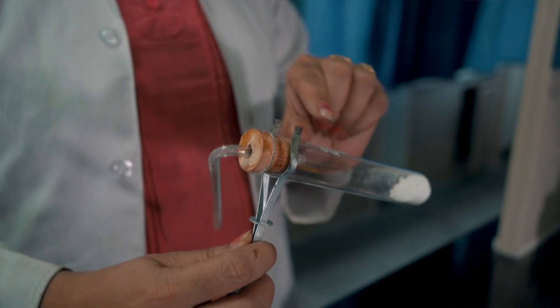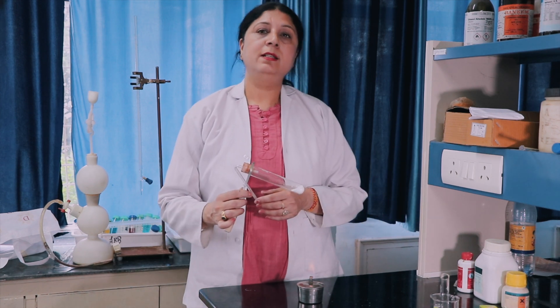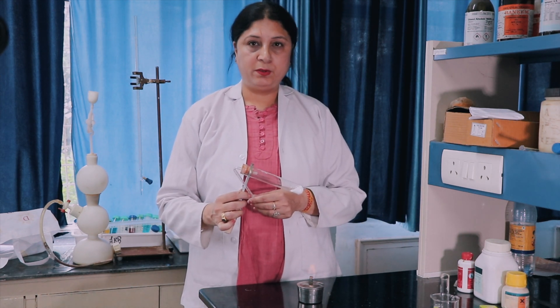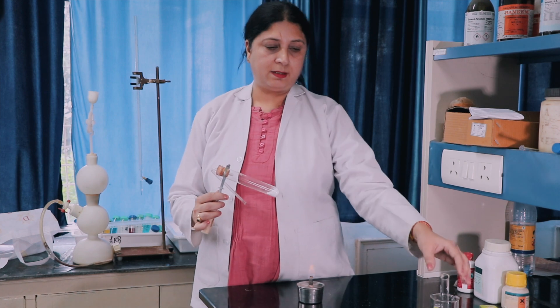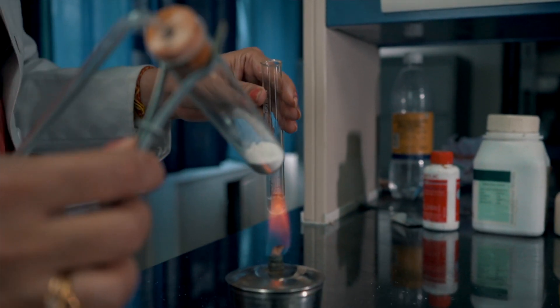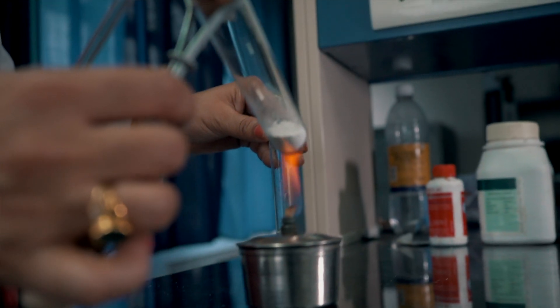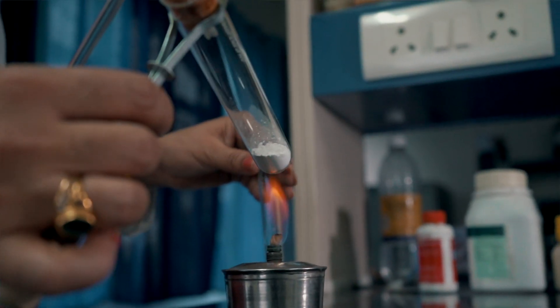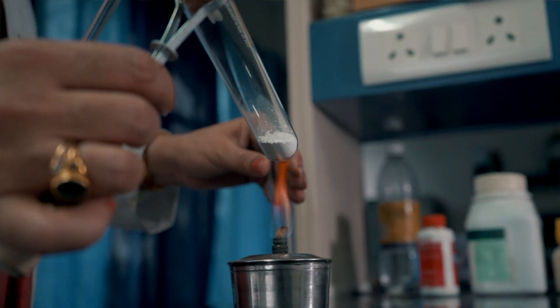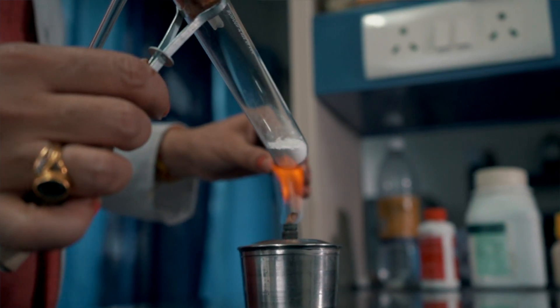it may not fall back into the test tube, otherwise the test tube will break. Since carbon dioxide gas would be produced, the gas can be tested with the help of lime water. So I have taken lime water in this test tube. Now when the salt is heated, heat will decompose zinc carbonate into zinc oxide and carbon dioxide gas.